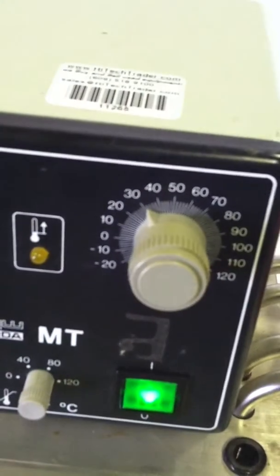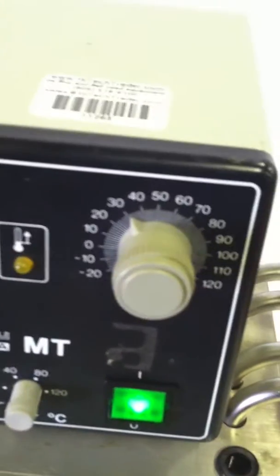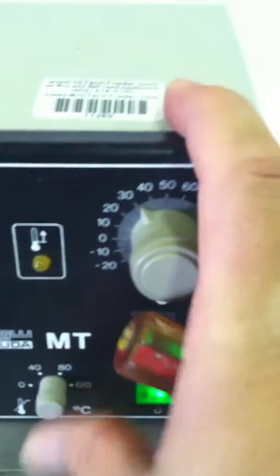You can see it's regulating on and off, keeping a constant temperature. We have it set at 30 degrees. The over temp works. Turn it down, it should shut off the whole unit, which it does. Bringing it back up and hitting the button.